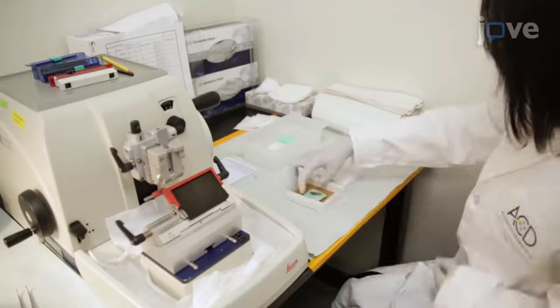Subsequently, the sample is processed and embedded in paraffin using standard procedures.